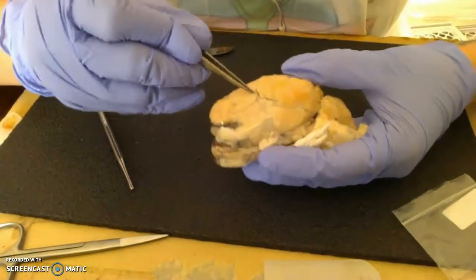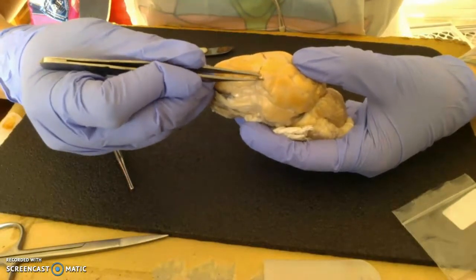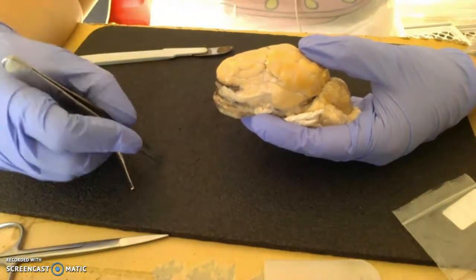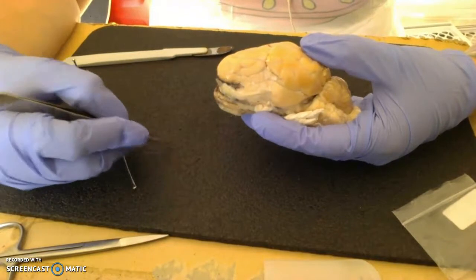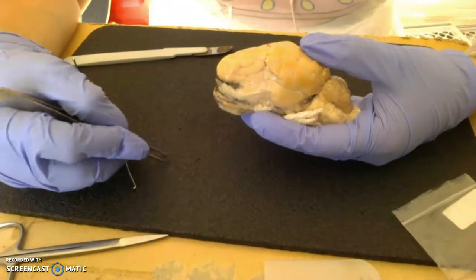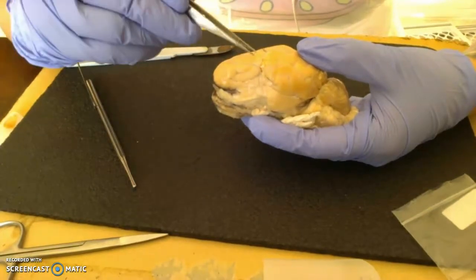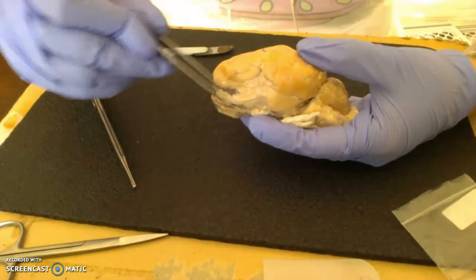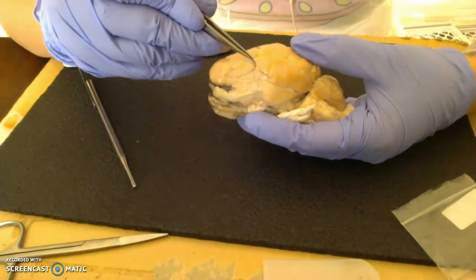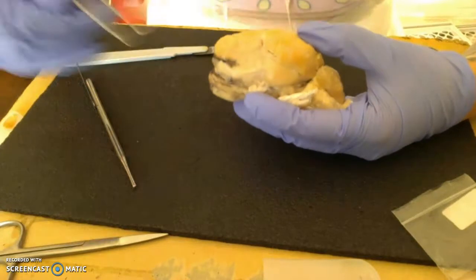And then we additionally have our meninges, which is Greek for membrane, which for us is technically a collection of the three membranes that encase the brain, working superficially, going proximal or inferiorly. We have the dura mater, which is not shown here because it's a much harder membrane. Then we go into the arachnoid and then the pia mater. So I believe this one is actually probably the pia mater.